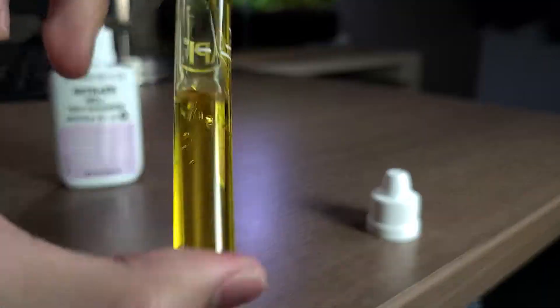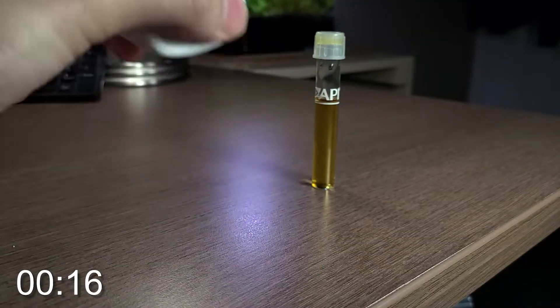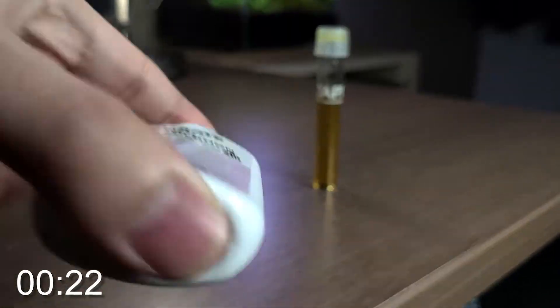Now, before we add bottle number two, we will need to really shake up the bottle for 30 seconds. Please do not forget this part. It is extremely important to ensure an accurate test result.